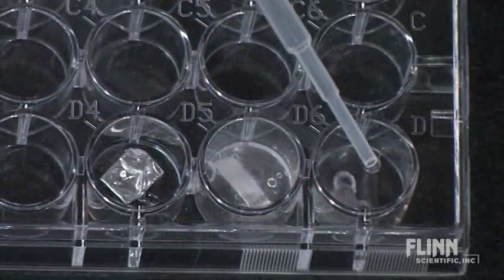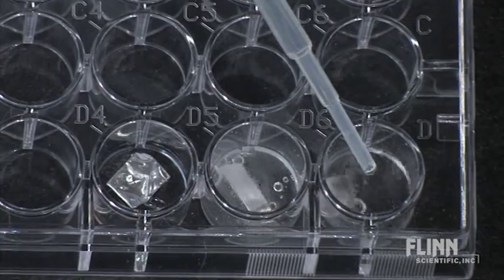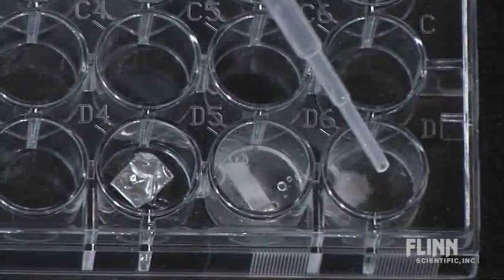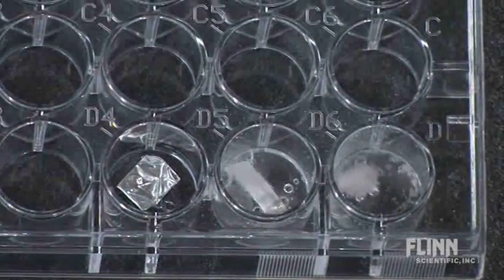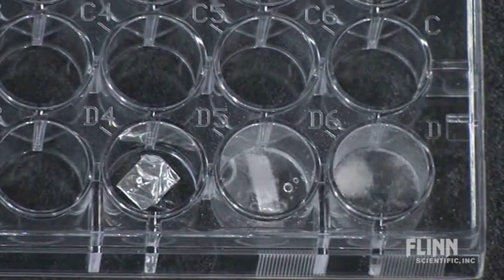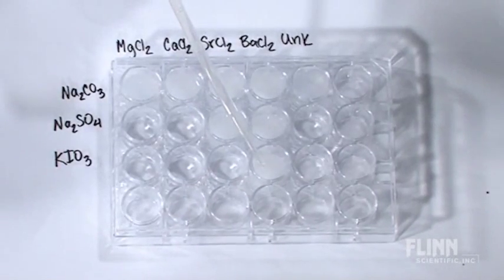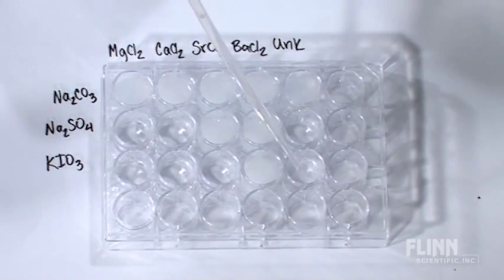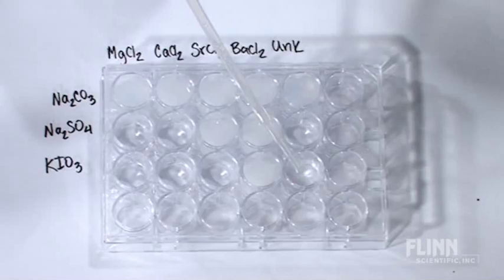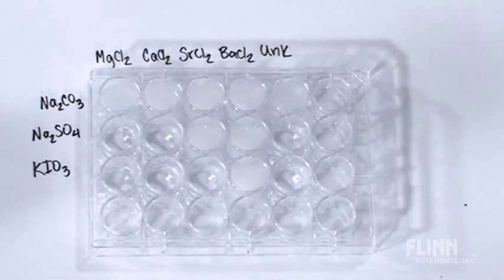Students begin with a series of reactions to discover a trend in metal activity both within a group and across the period. Then they study solubility patterns and use the resulting data to identify an unknown.